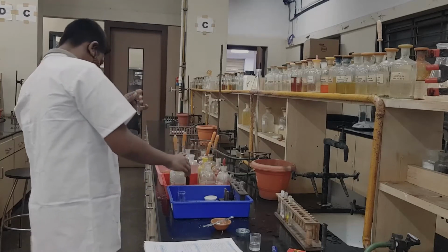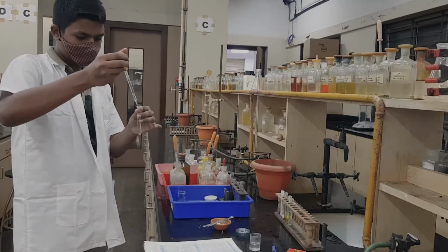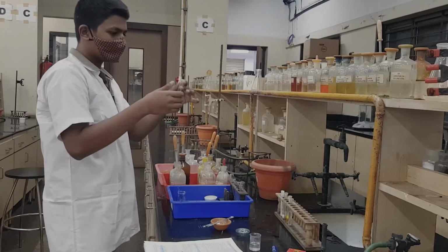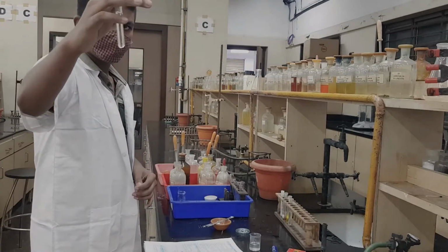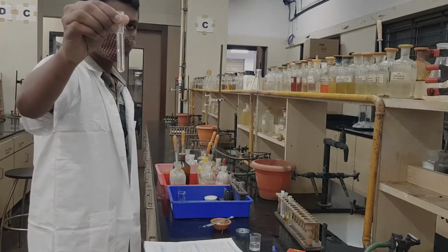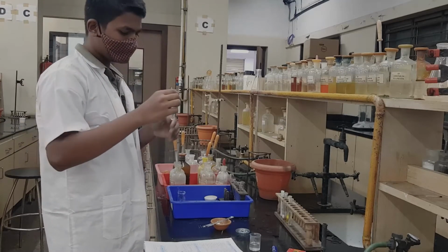You will use a dropper, and ammonium hydroxide is in an amber colored bottle. You can keep your thumb on the top and invert it so that the OS does not remain unreacted, so there is a uniform distribution of the reagents. You can see it is clear, that means there is no PPT. So, group 3 is absent.